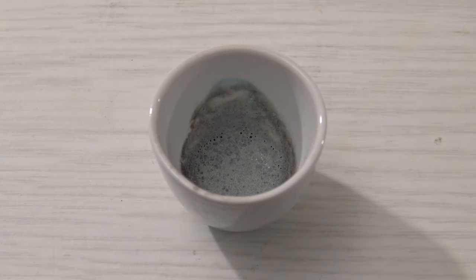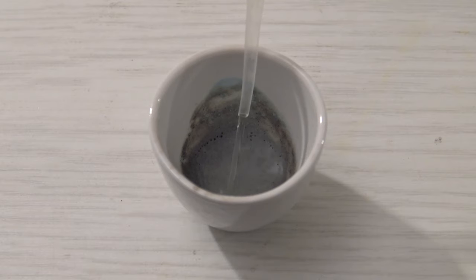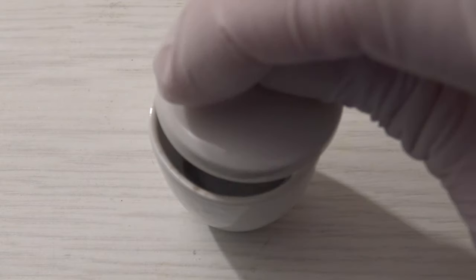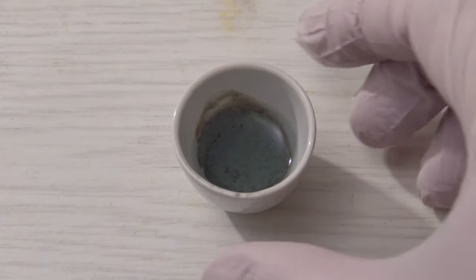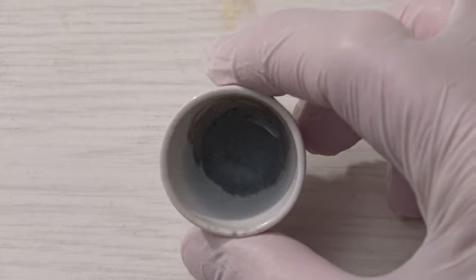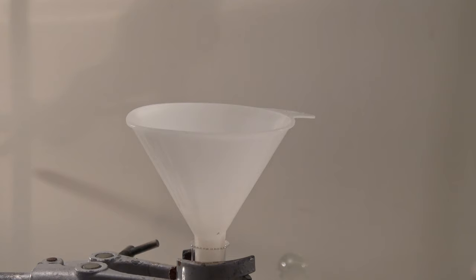Next, the proof can be made more specific by adding distilled water to the solidified mass. After a while, a small part goes into solution and the color of the manganate becomes visible. The solution was added to a test tube, which led to the color being more obvious.